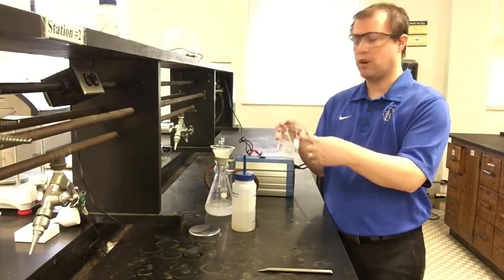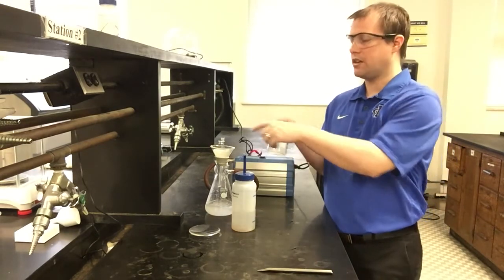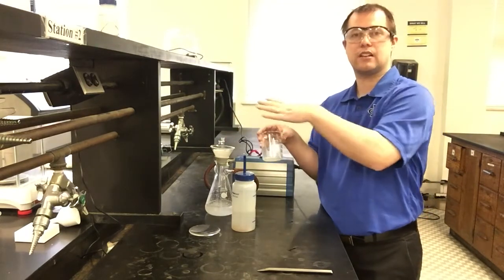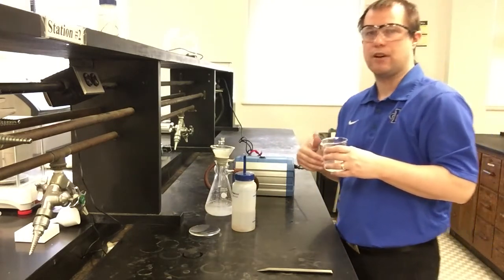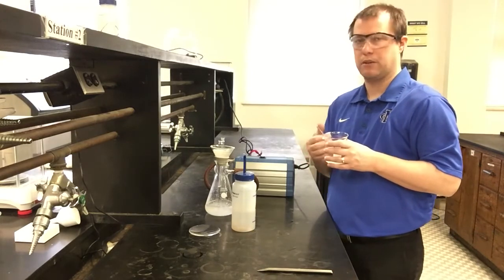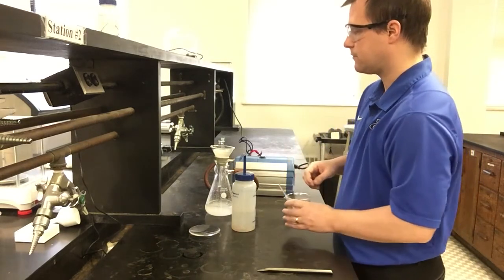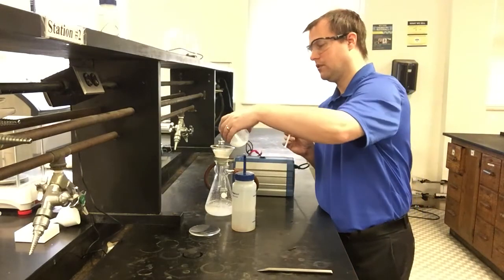I'll do this probably once with this little rinse that you just saw me do. Then, once it's all empty and most of this is drained, I'll probably just do a rinse through the beaker while holding the beaker over this, so I can collect anything else that might be on the sides. That way I get hopefully all of my product out of my starting container where I did my reaction, and all my product onto the filter paper where I can collect it and mass it at the end. So, almost to that point, I'm going to go ahead and add this little bit.